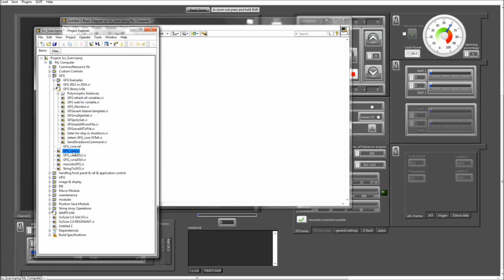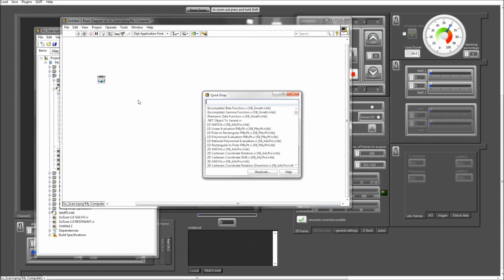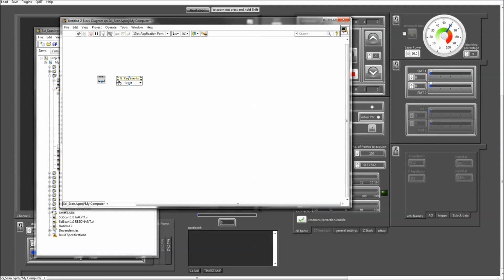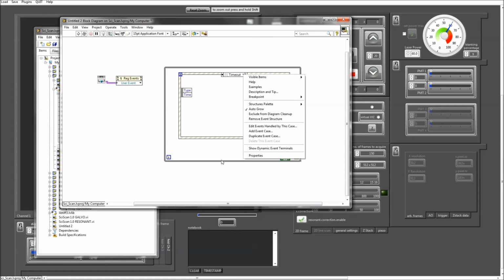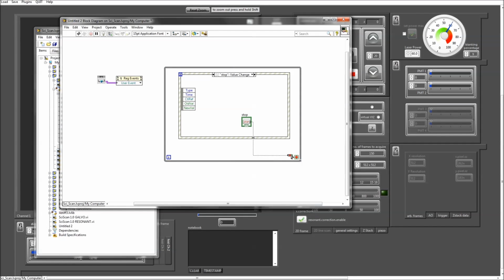You need the reference from that core GFG VI. Then you want to register for an event. Obviously, you're going to need an event structure. Now I'm just going to create a case here to handle stopping this loop around the event structure. So I'm going to add an event case here. Whenever that value changes, it's going to stop the loop here.